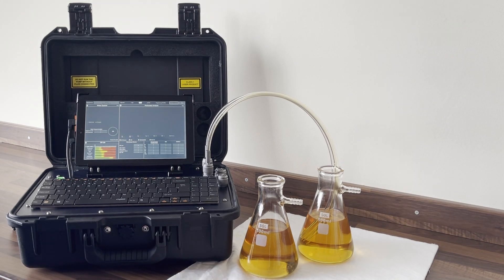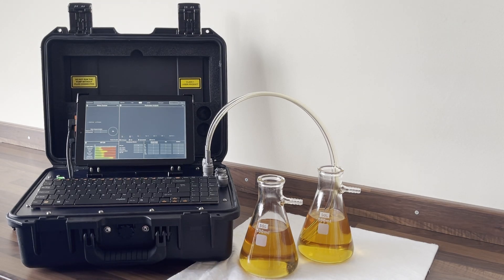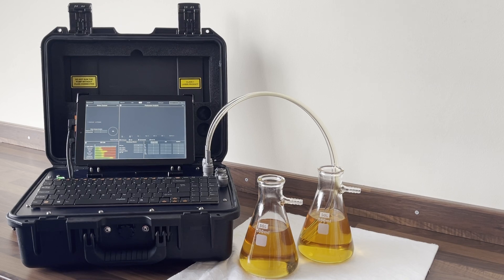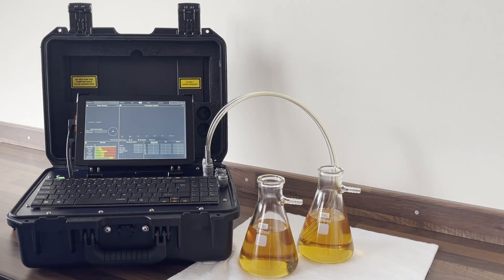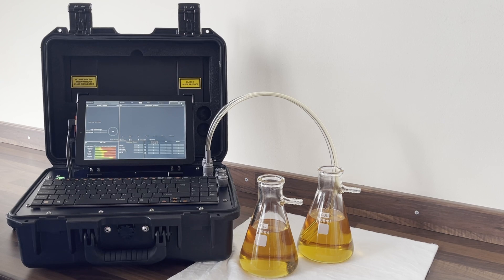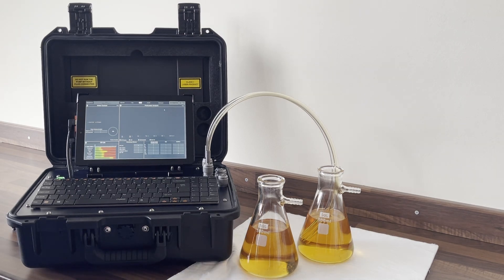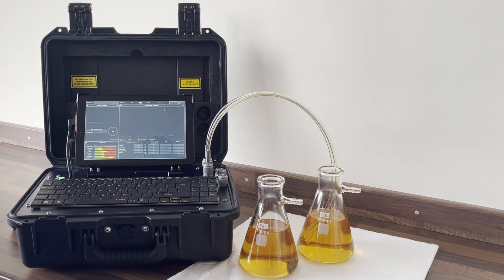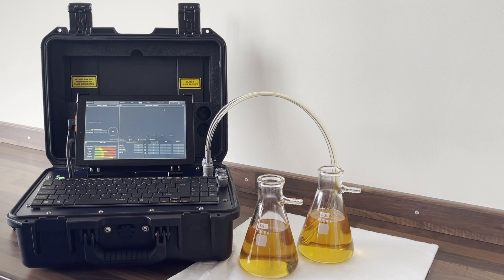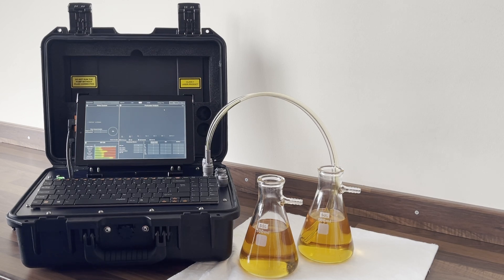On the side we've got two sample bottles, each filled with the same 32-grade hydraulic oil. We're going to be conducting two tests. In the first test we're going to be looking at the sample and the results with no air, and in the second test we're going to be looking at the sample after it's been aerated.